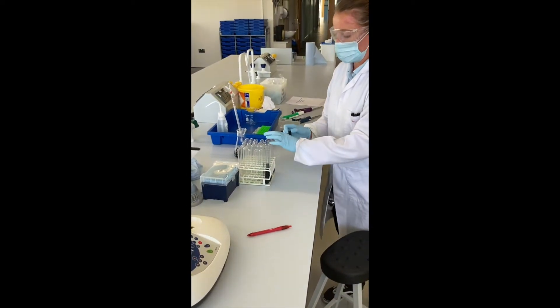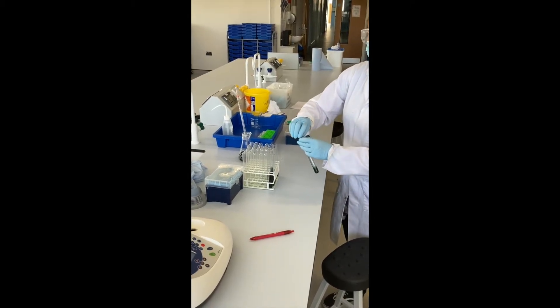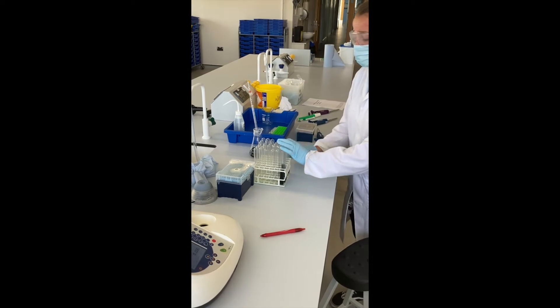Remove that sample and put it back into your sample tube. Keep all your samples until the end of practical in case you need to take readings again.